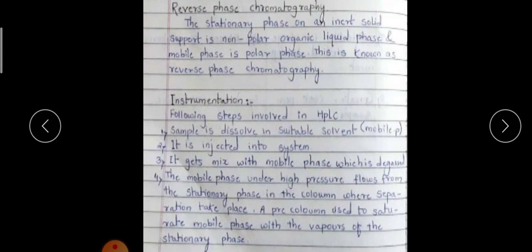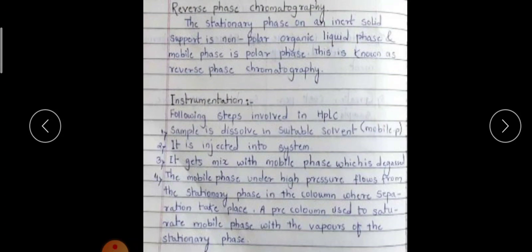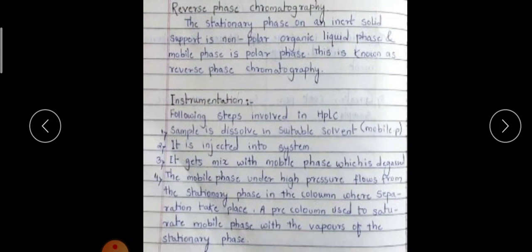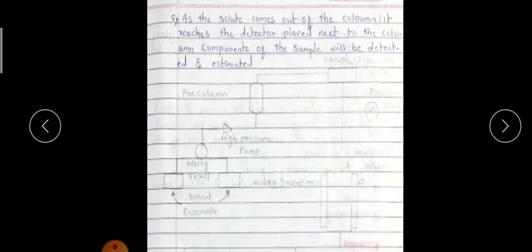Now we have to talk about the instrumentation. The following steps are involved in HPLC: the sample is dissolved in a suitable solvent — that is the mobile phase — it is injected into the system and gets mixed with the mobile phase, which is degassed. The mobile phase under high pressure flows through the stationary phase in the column where separation takes place. A pre-column is used to saturate the mobile phase with vapors of the stationary phase.